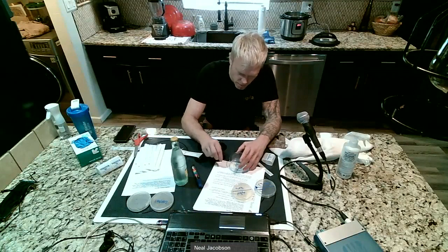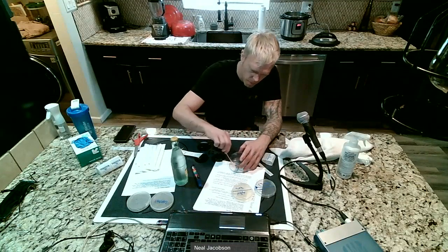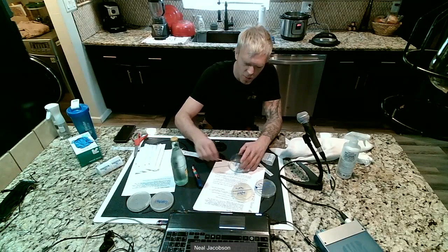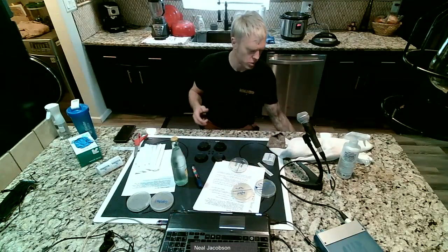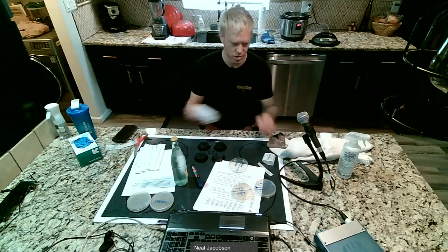I'm just going to rub it and try to cover every bit of surface area on the nose side with my Q-tip. And be very gentle with your plate too. It's super easy to tear up the agar if you push too hard. And you might find that out the hard way, and that's okay. I mean, we're just learning here.